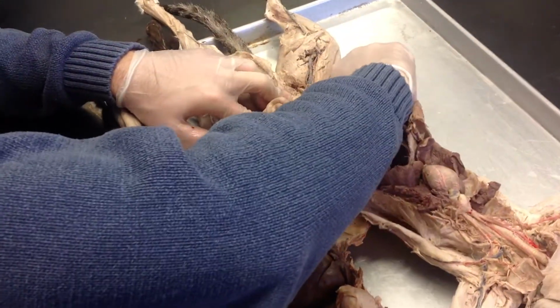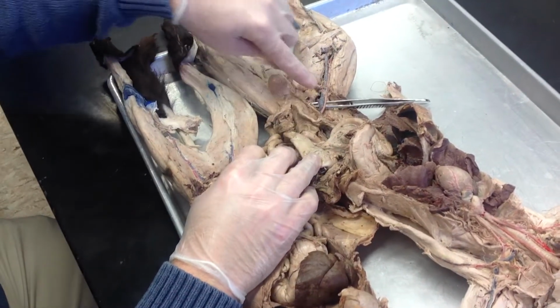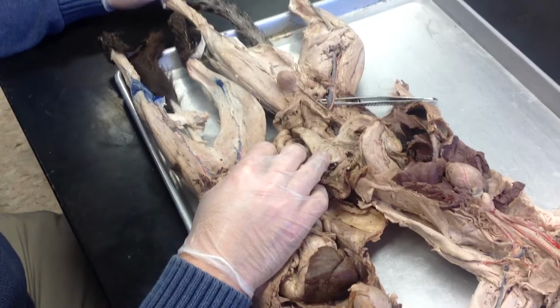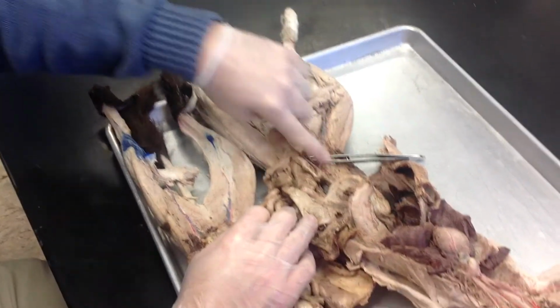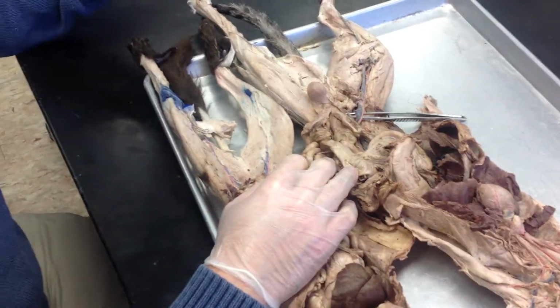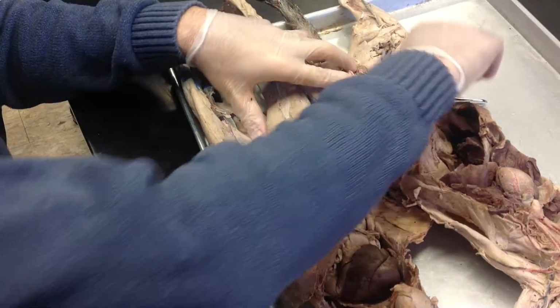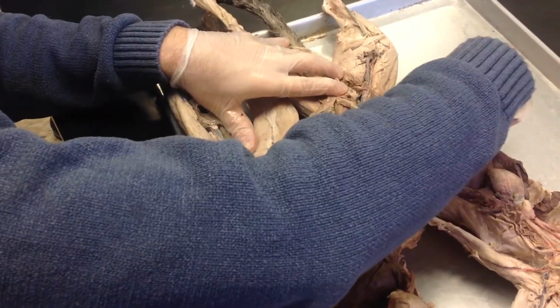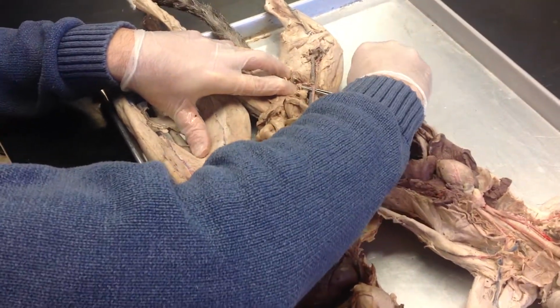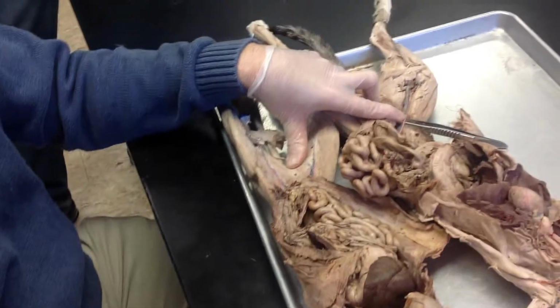Now, there is a common iliac vein and an internal iliac vein and an external iliac vein. There's no common iliac artery, and the arteries are on top. So, to be honest, if I pin something here, you could get it wrong just because you're thinking human when you're looking at a cat. So, to prevent that, the only thing that you see here is the external iliac artery. That's the only artery. The internal never fuses with it. So, if I ask it close to the body wall, that's the external iliac artery.